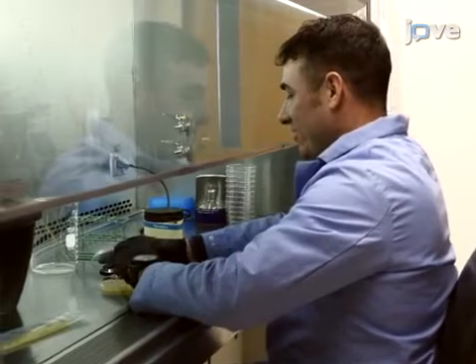Along with myself, Eric Burchard, a technician in my laboratory, will demonstrate this process in the following video.